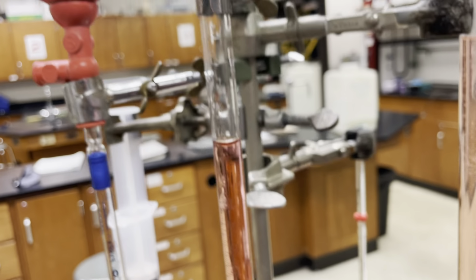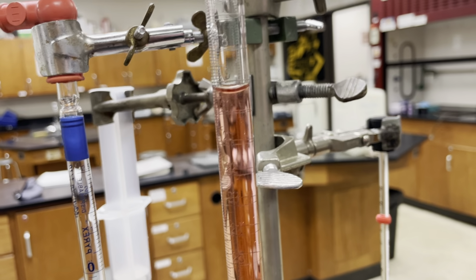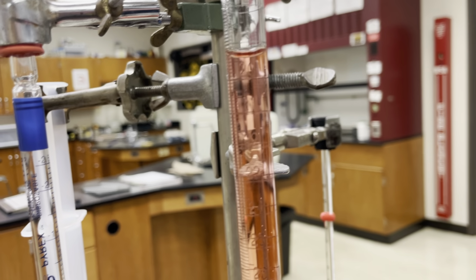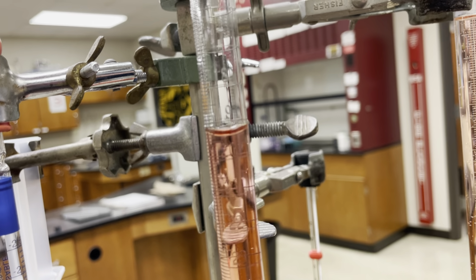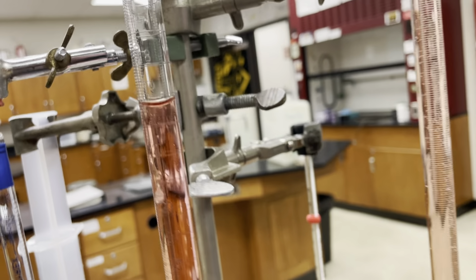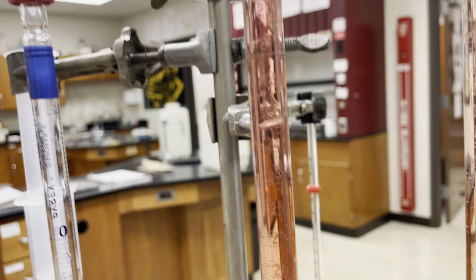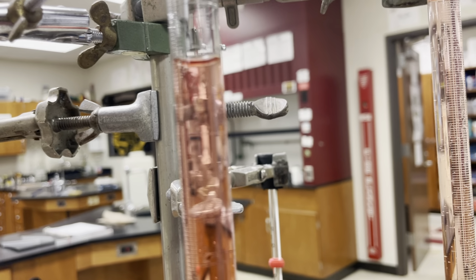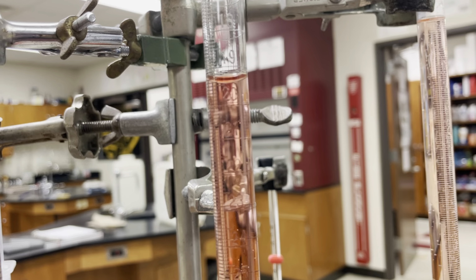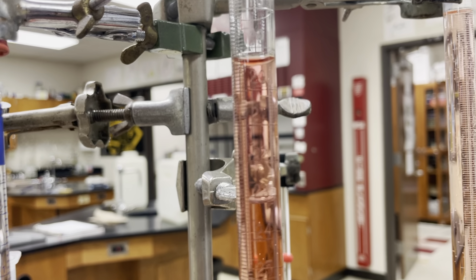Okay, if we can get this to focus here. Close. So that's 19, and again, we're counting downwards, so be careful. If I'm seeing a line above the 20 mark, then that's not saying 20 point something.